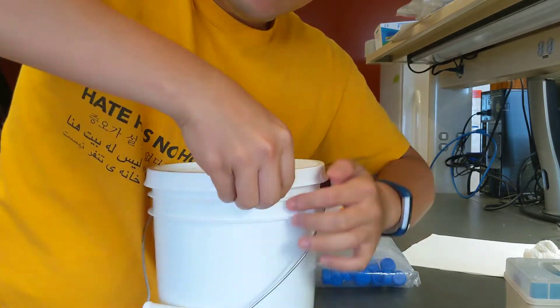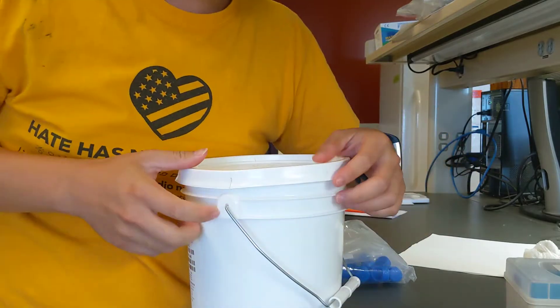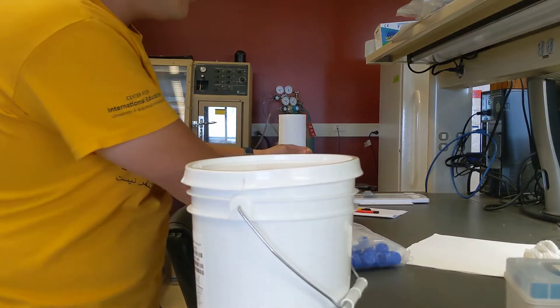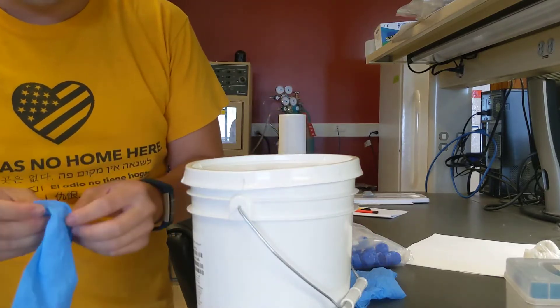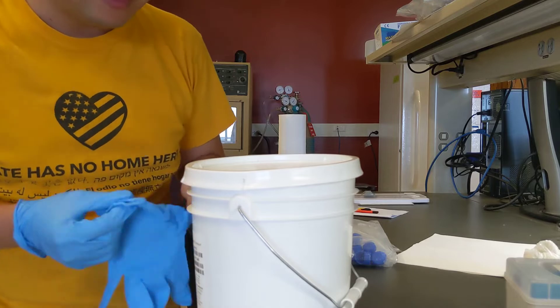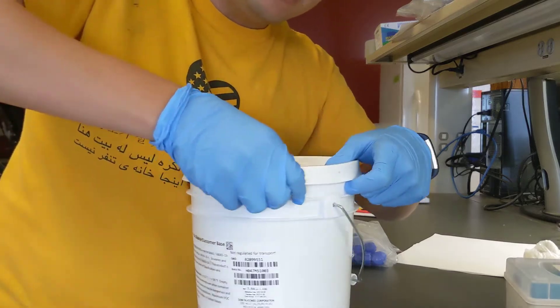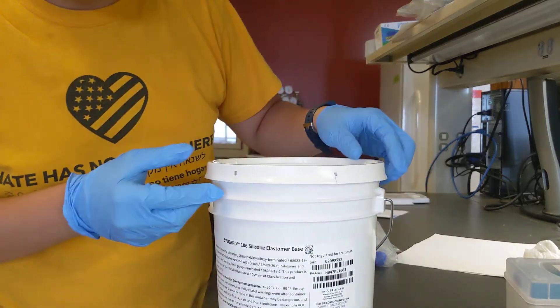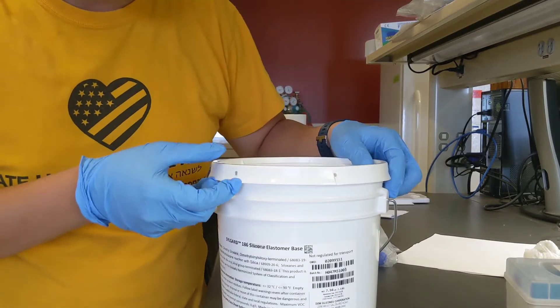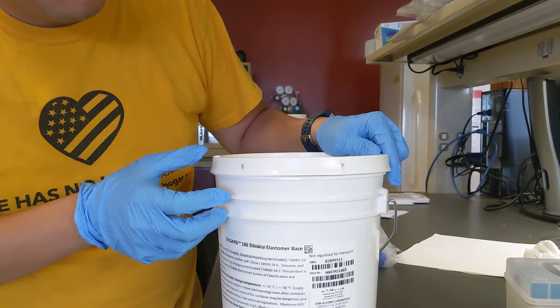You will see some clips. If you don't want to get your hands dirty, you can always put on gloves, because when you open the PDMS it can be really sticky inside. It's always a good idea to put on gloves before opening it. You can see the cap already being lifted by the way I bend it — this is how you open it up.